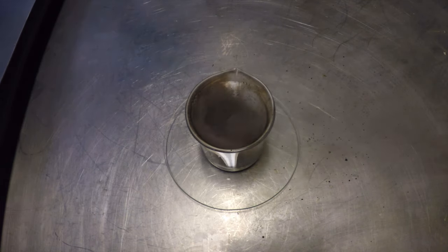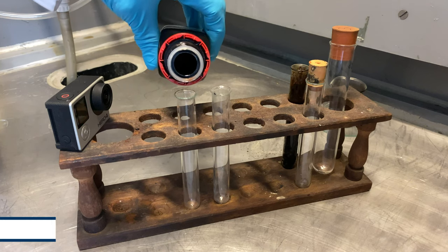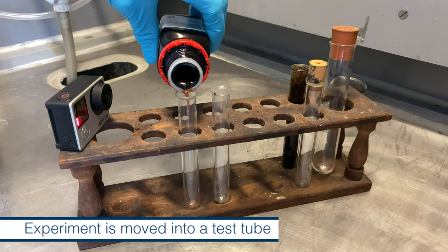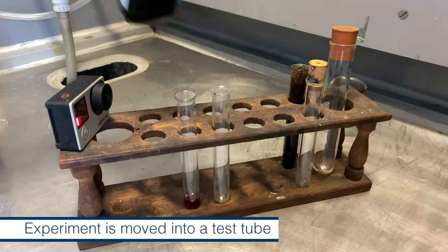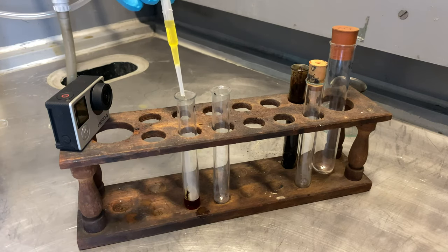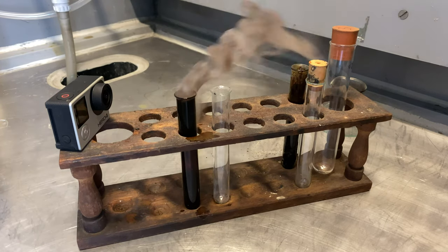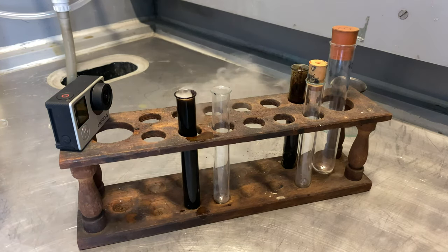To begin with, there were some popping noises, but then, as the aniline warmed up a bit, it really did burst into flames. A rather smoky flame came out at the top of the test tube.